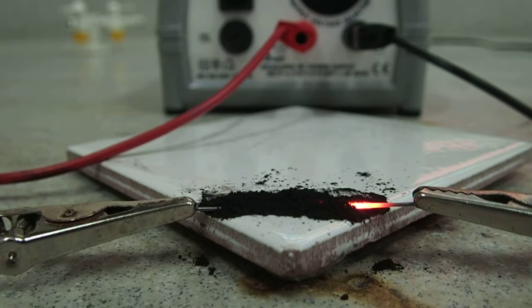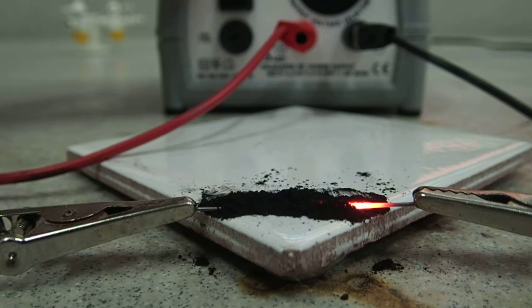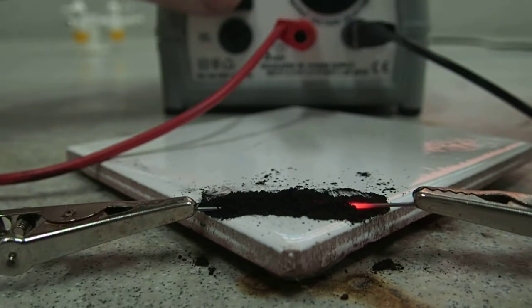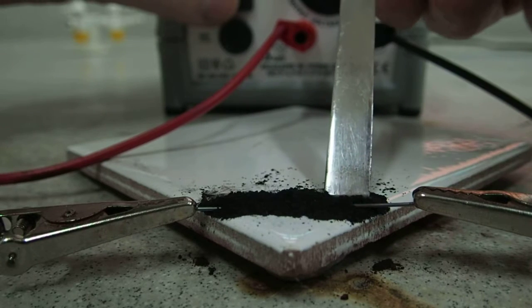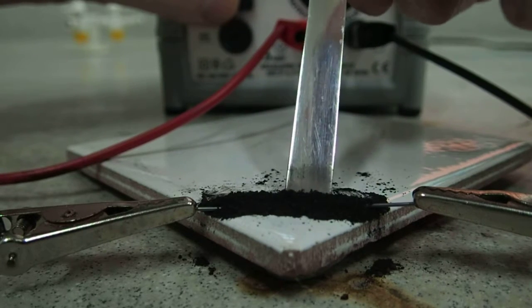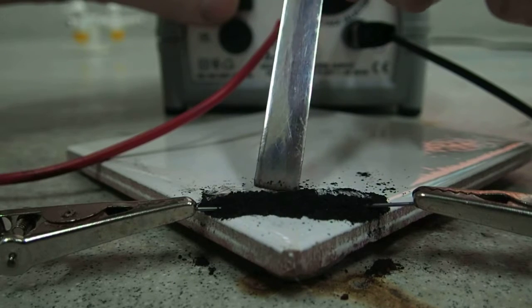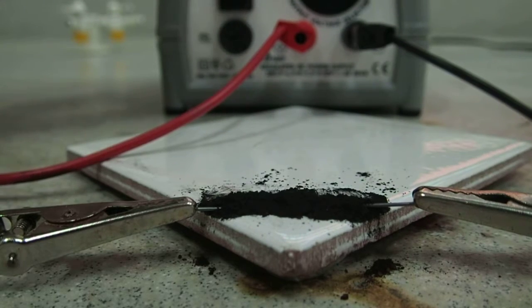You can always turn off, as I've done now, and redistribute the mixture or recover the pencil lead, as I'm doing there, and then turn back on.